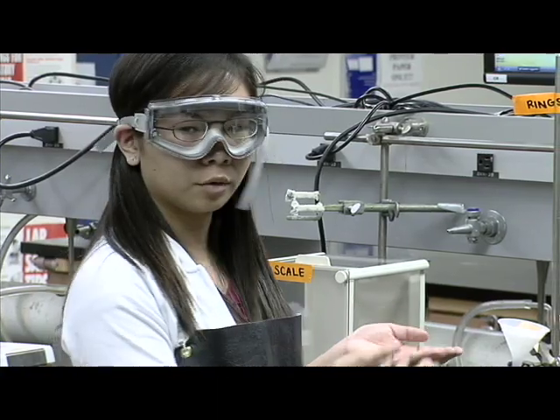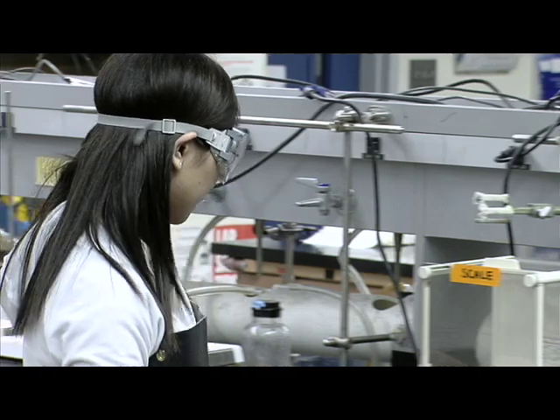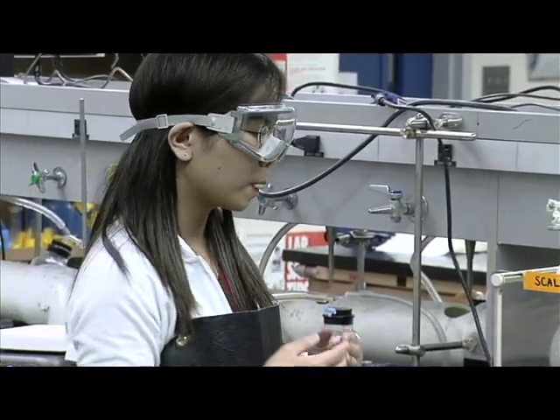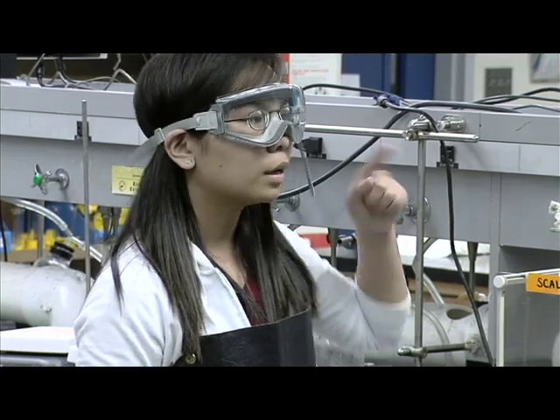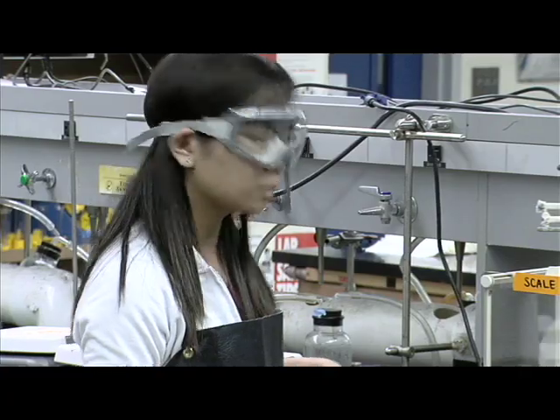We're going to weigh the solid with the filter paper on the watch glass, and we're going to find the mass of the precipitate from the final mass minus the initial mass.